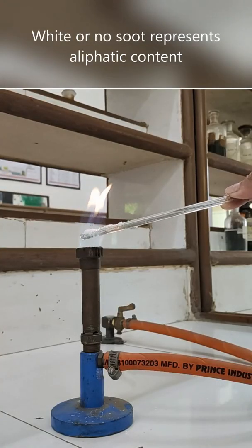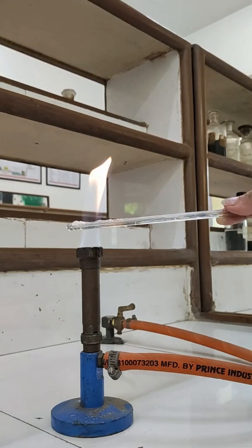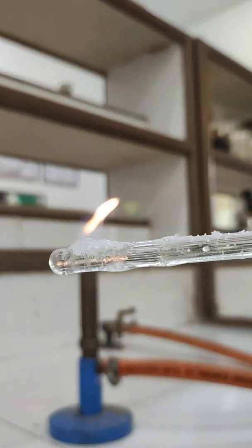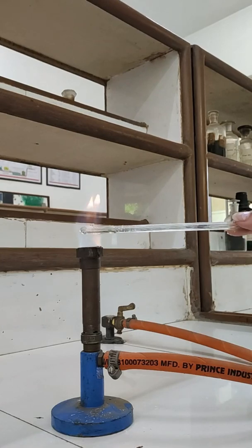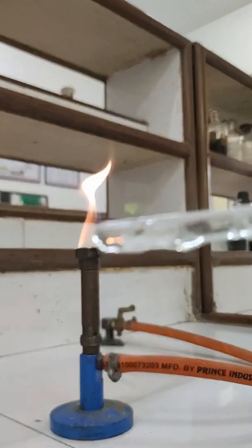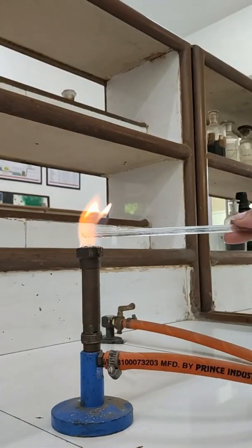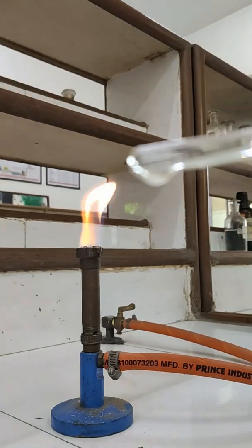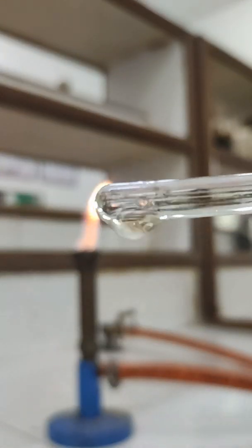Now let us change the compound. I have taken oxalic acid here — you can also take citric acid or tartaric acid. Here there is no black residue; rather the compound is melting and it is giving white flames. No black flame is there. In this type of flame test we just take the compound and let it burn. It is only white flame — there is no black residue, neither the residue is black nor the flame.